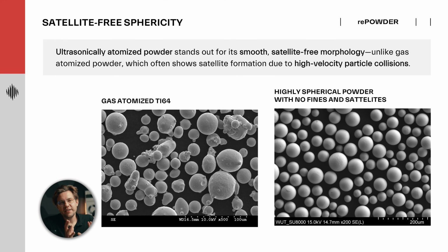This episode will compare qualities and characteristics of gas-atomized and ultrasonically atomized powders. Right now on the screen you can see two SEM images. On the left you can observe typical gas-atomized Ti64. On the right part of the slide you can see ultrasonically atomized Ti64 powder. The very same composition, completely different powders.